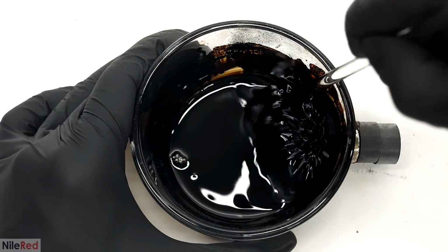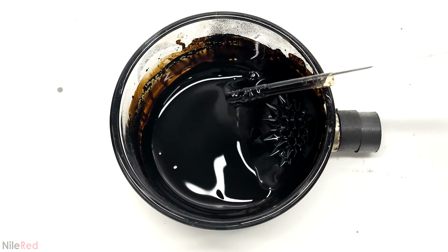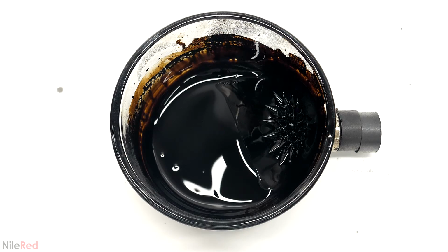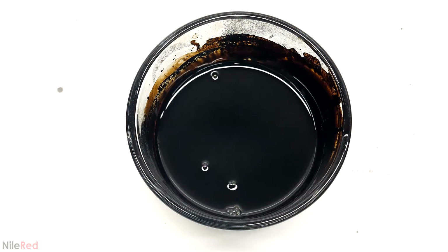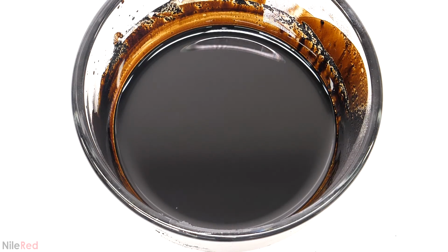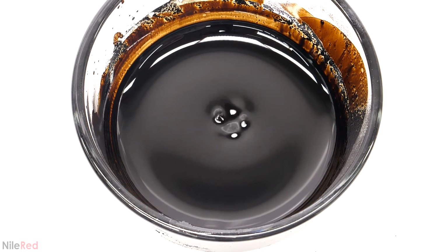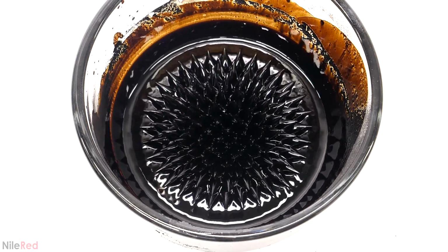I just did the same thing for another 5 or 10 minutes, moving this glass rod back and forth, and eventually, it all pretty much disappeared. I was doing all this mixing over a board like this, so once it was done, I was able to test it by just putting a magnet underneath. When I did this, I was really happy with the results, because under the magnetic field, it didn't look like it was getting any more viscous or anything.